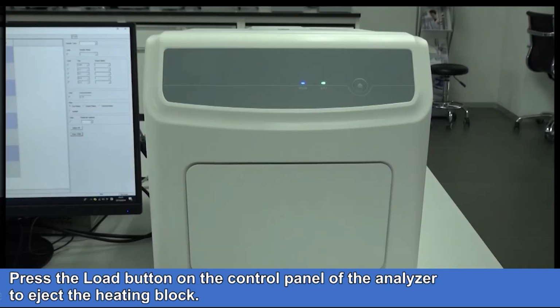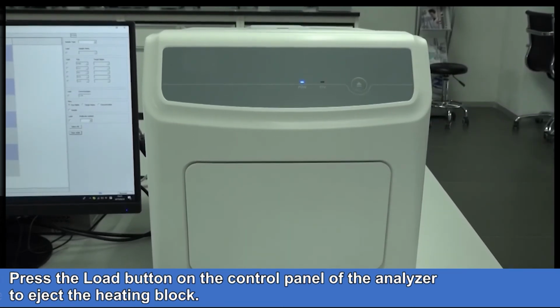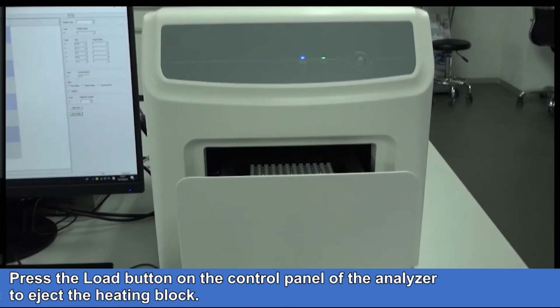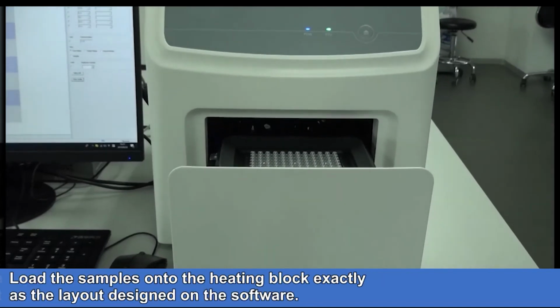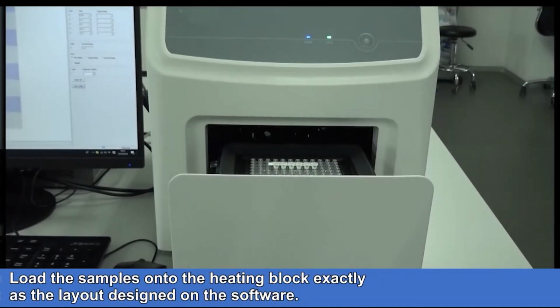Load the sample. Press the Load button on the control panel of the analyzer to eject the heating block. Load the samples onto the heating block exactly as the layout designed on the software.